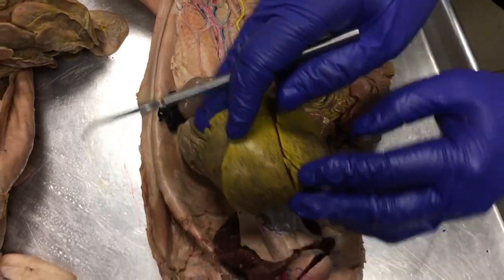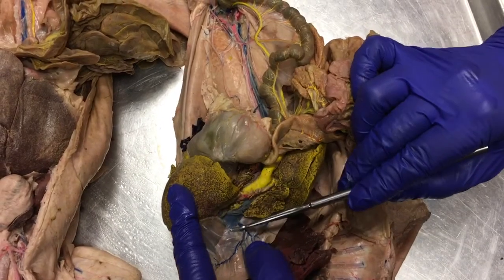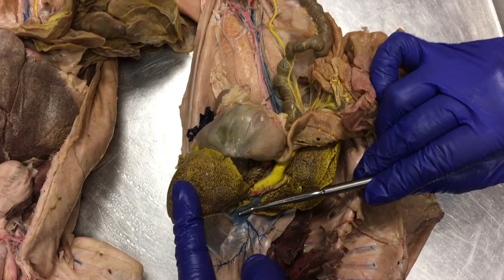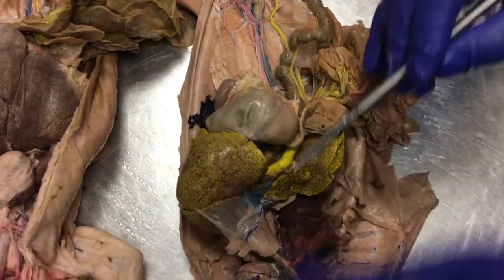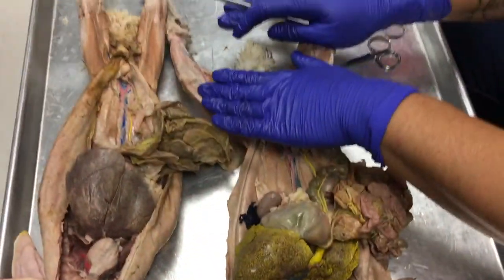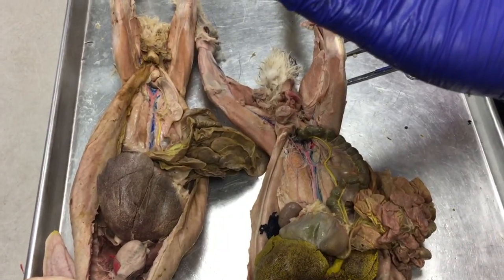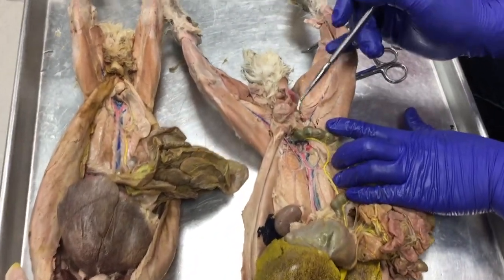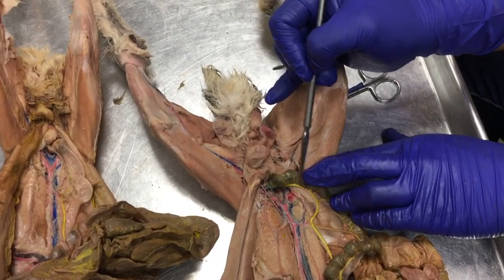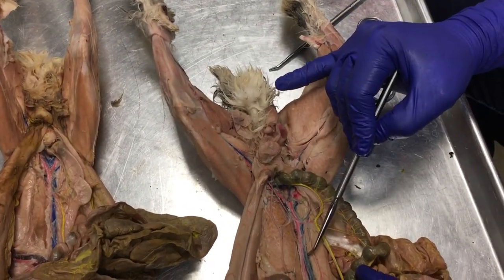And the blood is processed in the liver, and then it comes out this side in your falciform ligament as the post cava. Okay, the post cava then continues up to our right atrium. All right, so that's from the posterior. We have femoral to common iliac joining in with the caudal vein. Joining in are the iliolumbar veins and the testicular or ovarian veins into the post cava.